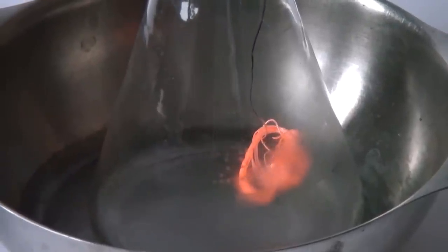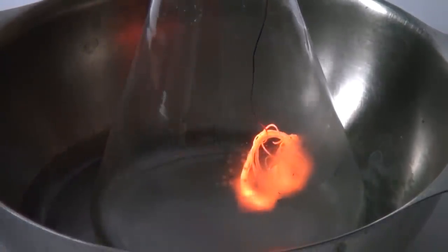Due to the fact that the flask has a smaller hole, acetone vapors will come out slower. Now let's see how this experiment looks like in the dark.